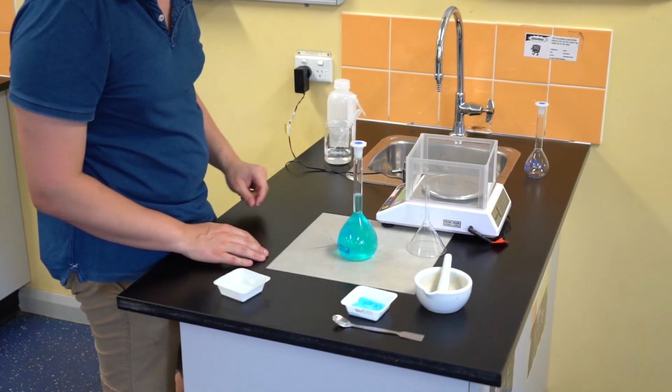In the next step, I'm going to be performing a 25% dilution, meaning that I'm going to be taking 25 mL of the standard solution that I have there and placing it into a 100 mL volumetric flask. From there, I can fill up the remaining volume in that flask with water and invert to ensure that concentration is even throughout the entire solution. What this will mean is that the concentration of the new solution will be 25% of the original solution.